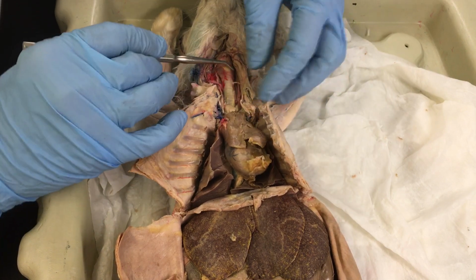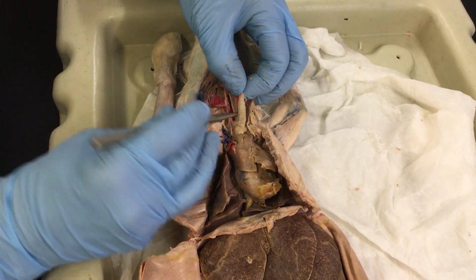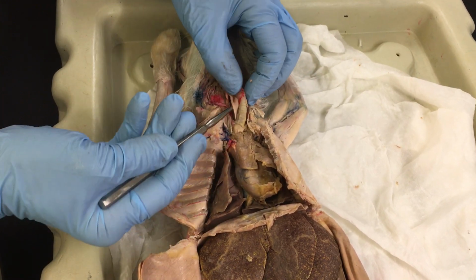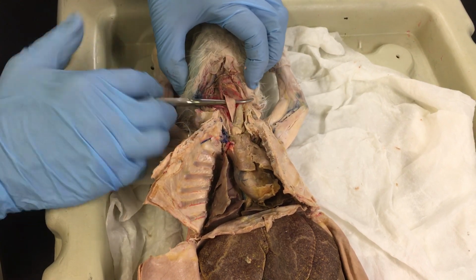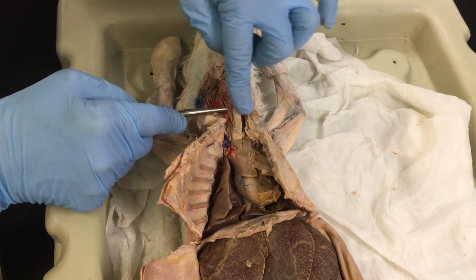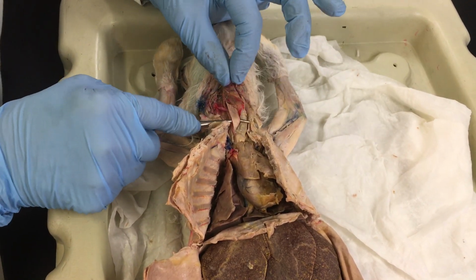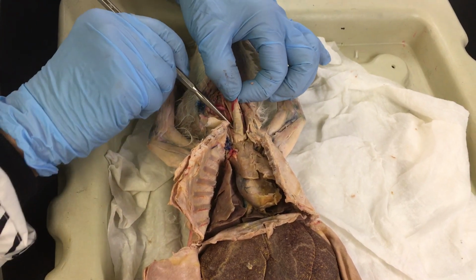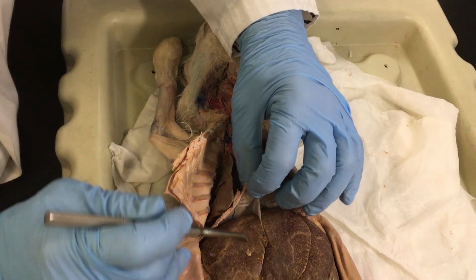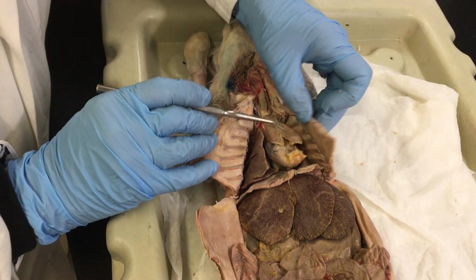Now, going back to the base of the throat, if we move the trachea, you can pull out this sort of tube-like structure, which is flat right now, and that would be the esophagus. It is flat and flexible, also behind the flexible trachea, to allow the food to go through, even if it is a large piece. It will go all the way down, and that esophagus then will end into the upper part of the stomach, which we're going to see in a moment.